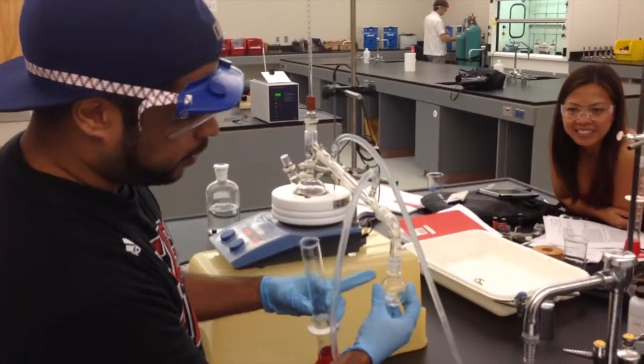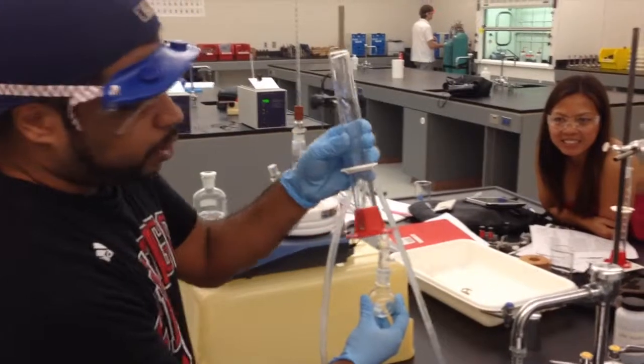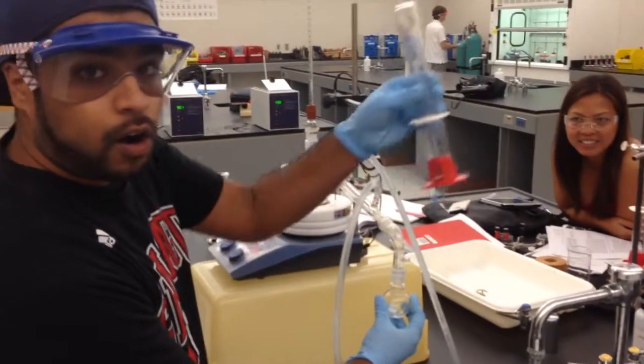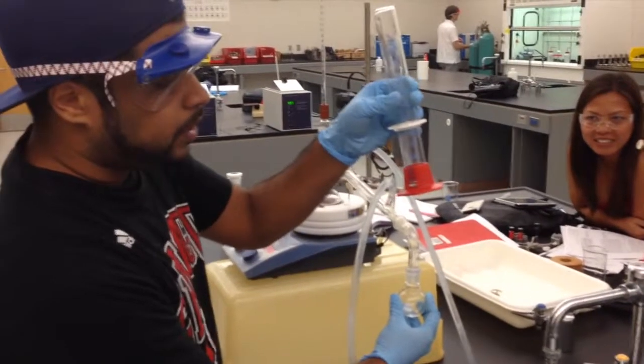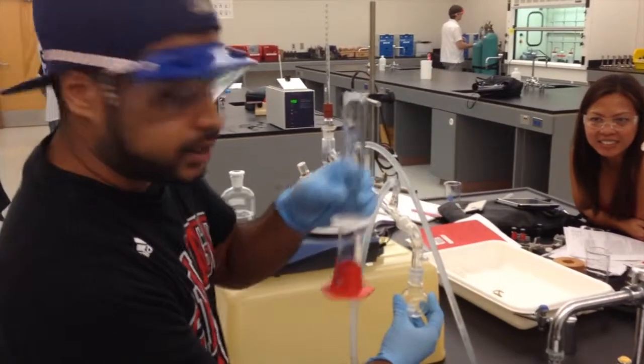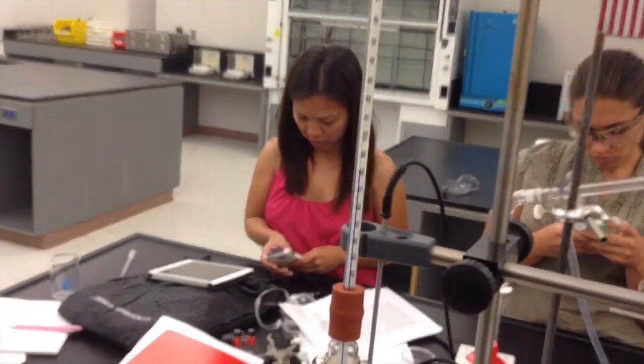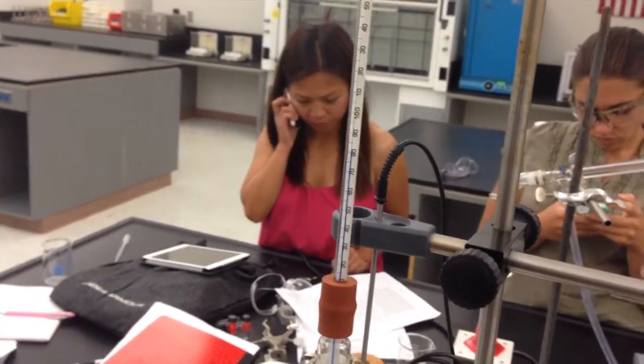And we're going to keep collecting the volume sample as we go on. Now we're going to run this, as well as what we collected from the fractional distillation, in the GC to see what our mixture is and what the concentration of each of our 2 components is. So 80 degrees Celsius is the mark that we're looking for, and as you can see, we are within 1 or 2 degrees of that 80 degrees.